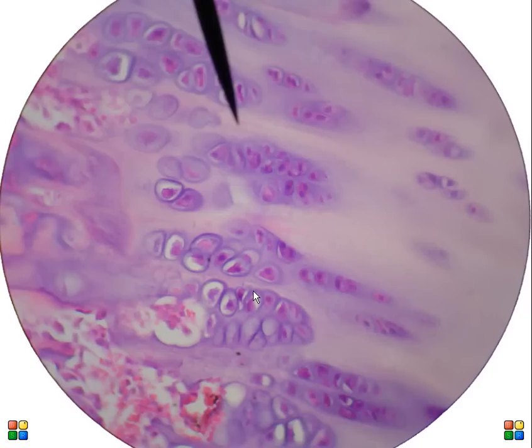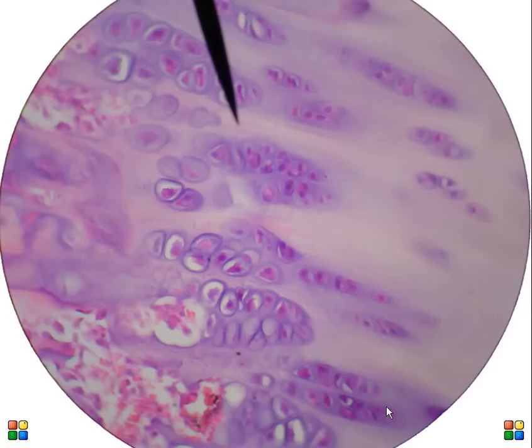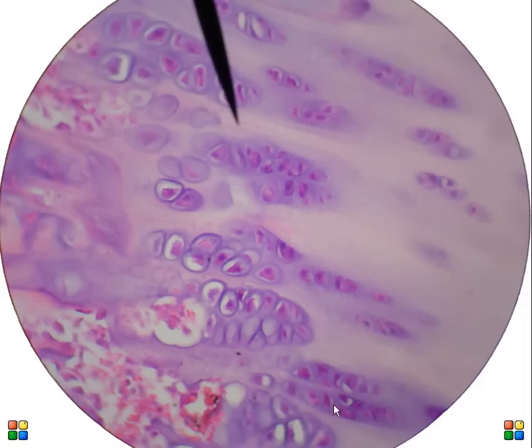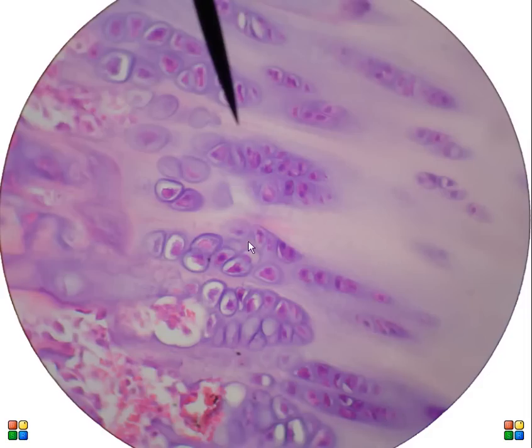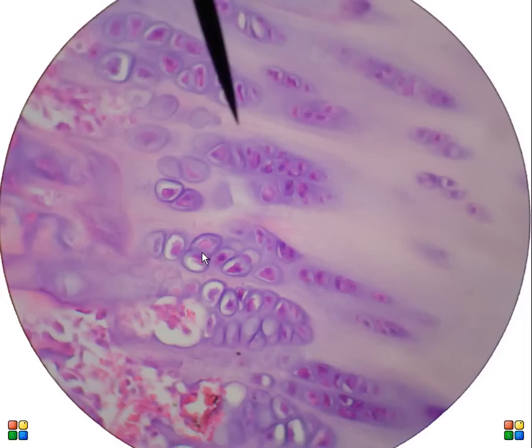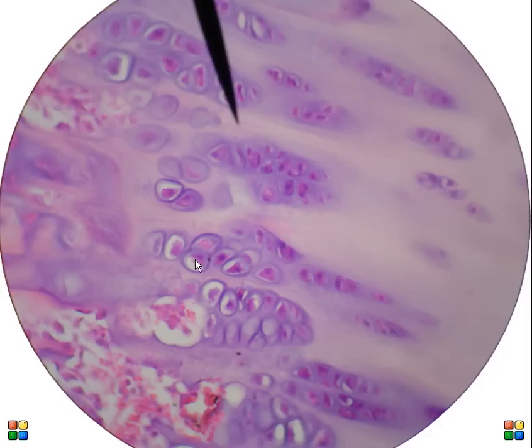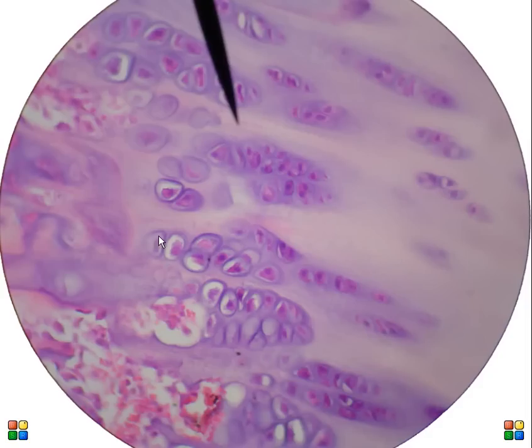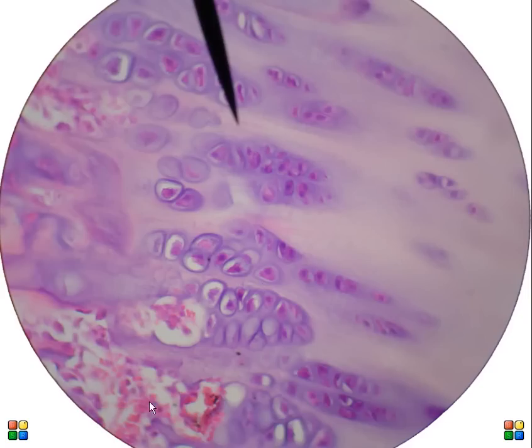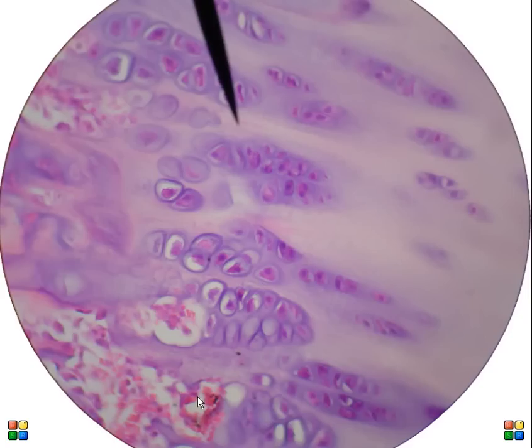Here's a higher magnification of the hyaline cartilage within a growth plate. The cells are dividing up here, giving rise to these stacks of cells within the growth plate. These cells are called chondrocytes because they're living in cartilage. We can also see some of the red bone marrow here — the reddish appearance is red blood cells developing.